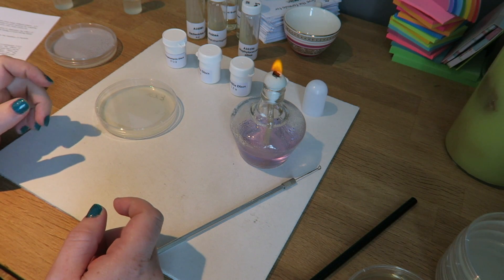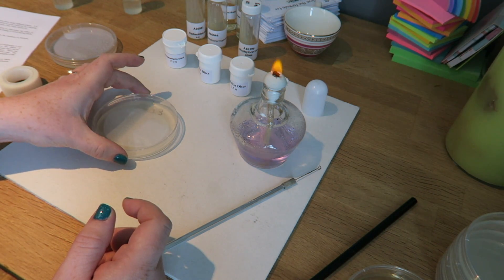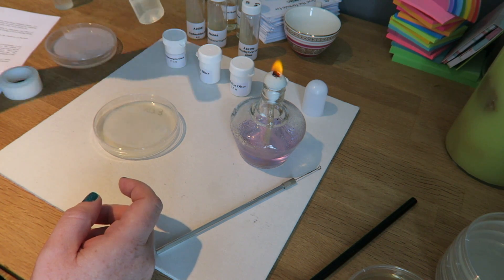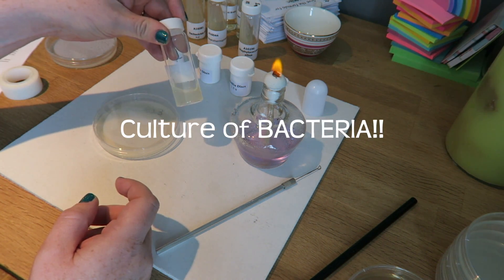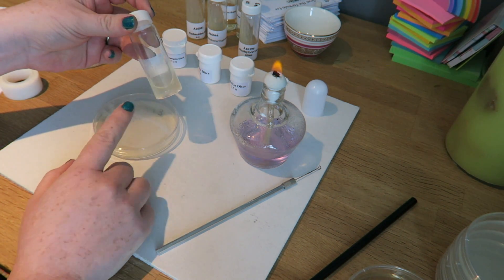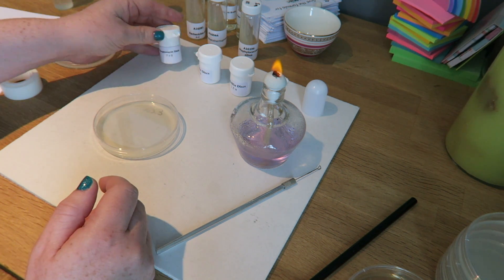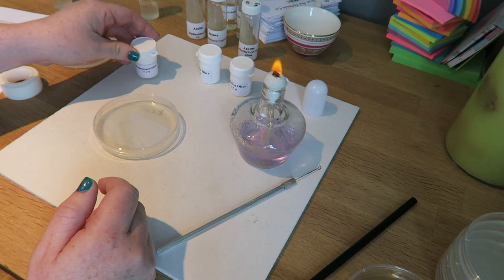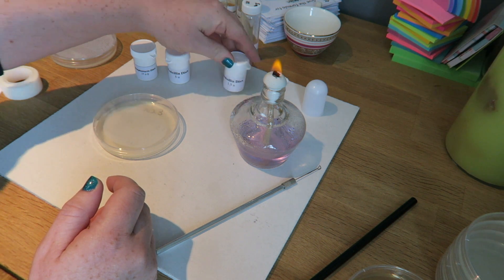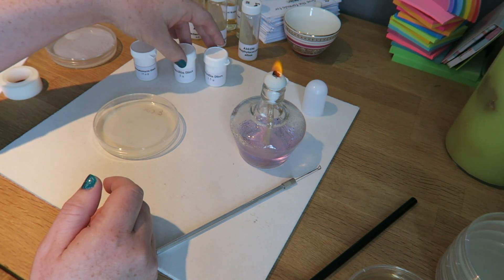When we look at how bacteria responds to antibiotics, what we need is a plate. We need a culture of the bacteria, and what I've done is just put some of this culture onto the plate and let it dry. I'm now gonna put three different antibiotic discs on here: streptomycin and penicillin at two different strengths.